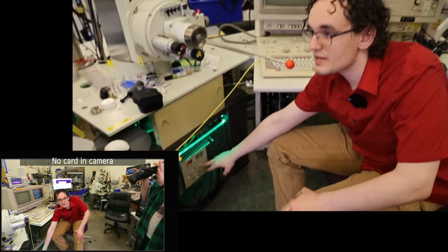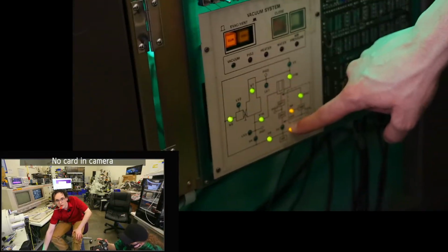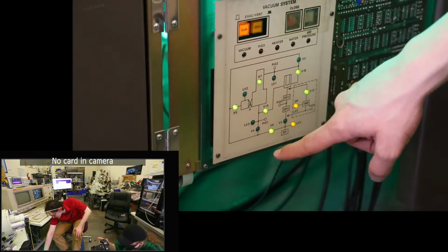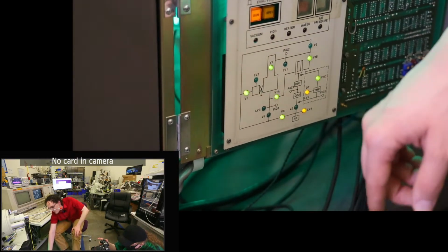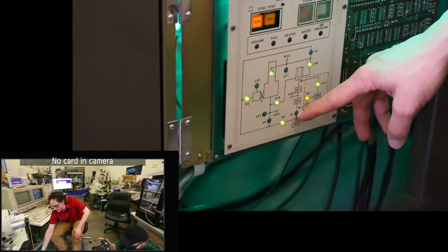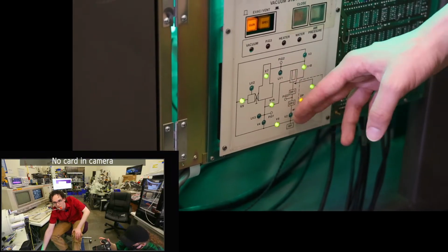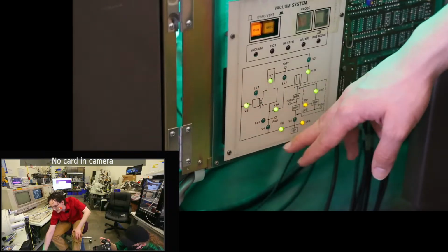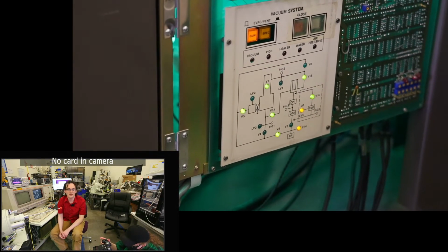If you want to look at our vacuum state diagram down here, we are currently using our roughing pump to pump through V6 and through V5 to pump down our load lock. And what it was doing previously was pumping through V2 to back our diffusion pumps and our diffusion pump buffer tank. But because we have a buffer tank, we can close V2, open V6, open V5, pump down the load lock, and then flip back to pumping the diffusion pumps, and we can do that all just with one roughing pump.